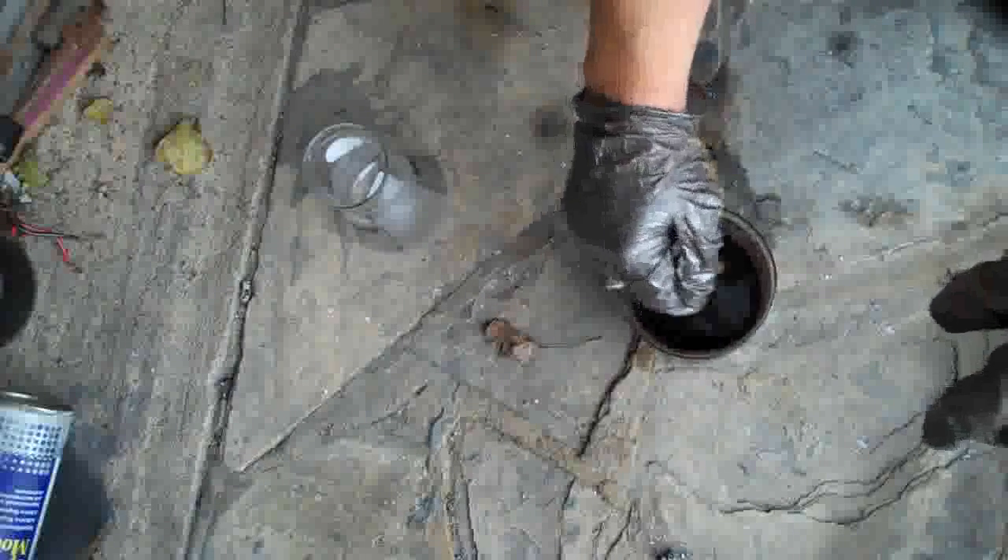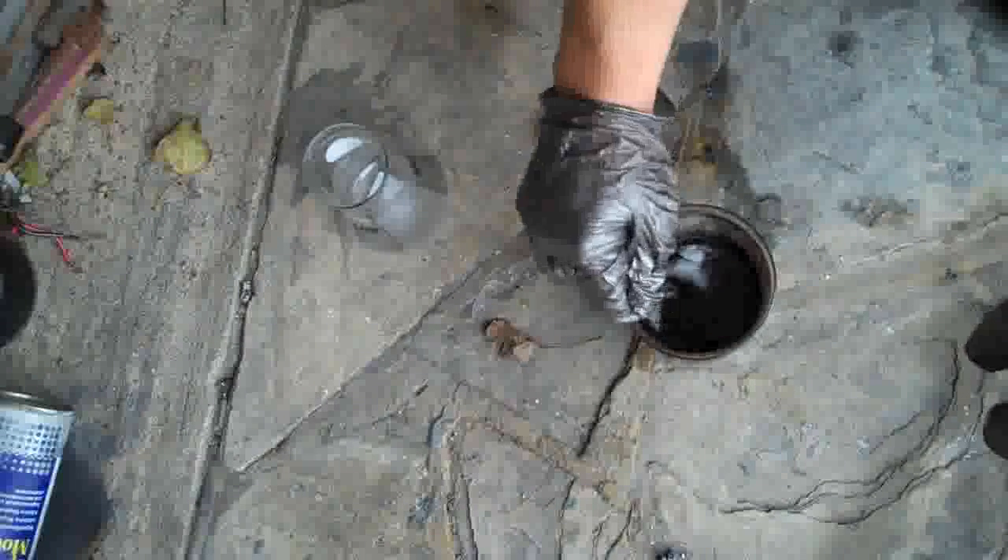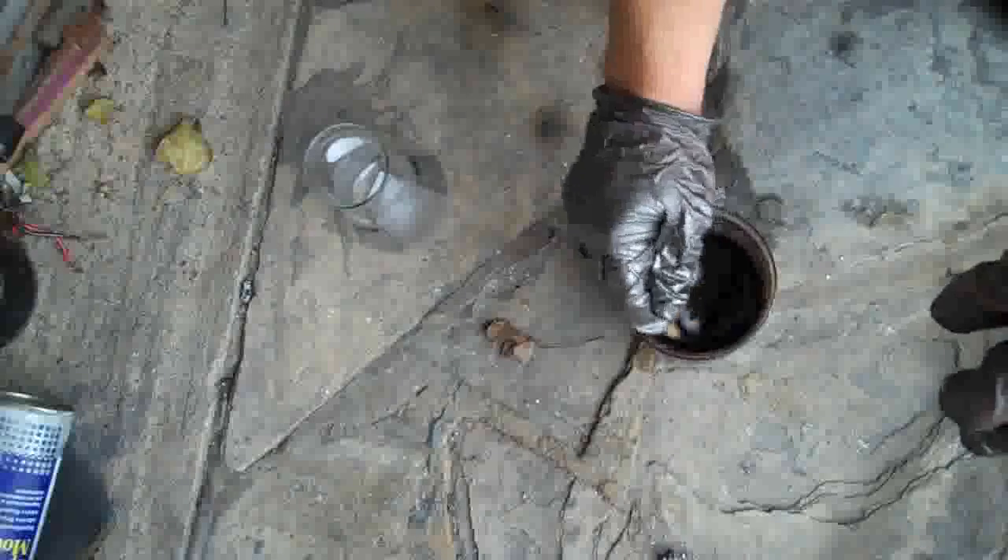It's only 100 millilitres of acid, incidentally. I've got it in this half-litre jar because you get quite a lot of expansion with it, and you need to have that expansion room. You can see it beginning to form up already - that will get to be quite a big foam even though you're stirring it like mad. To run through the amounts: it's 15 grams of potassium permanganate, 5 grams of exfoliated graphite, and 100 millilitres of concentrated sulfuric acid at 96% - you can use 96 to 98%. I'll get back to you when that's been stirred and foamed up for its half hour.